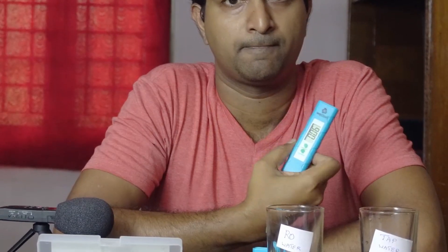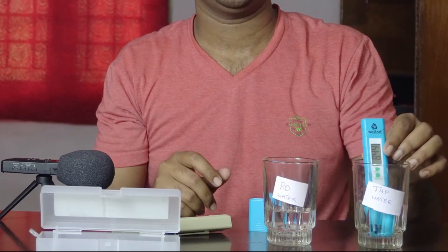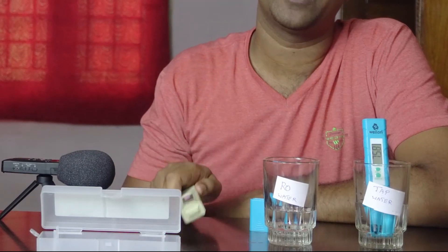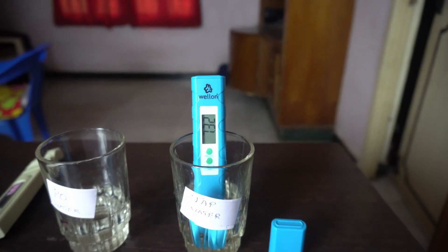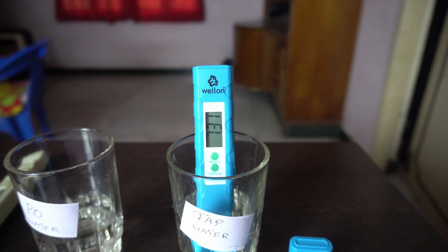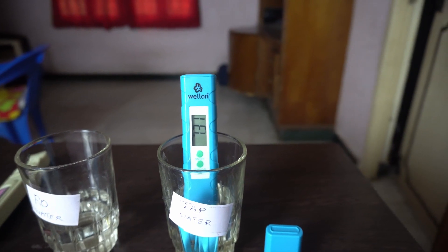So if you want to check the pH value, we will check the pH value. TDS is quick to detect, but pH takes a little time — at least 4 to 5 minutes to get the result. We will check the tap water pH. The value is settling. After waiting, the tap water pH value is 7.31.